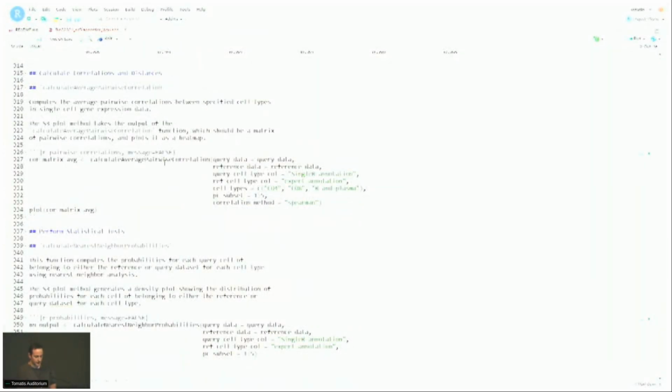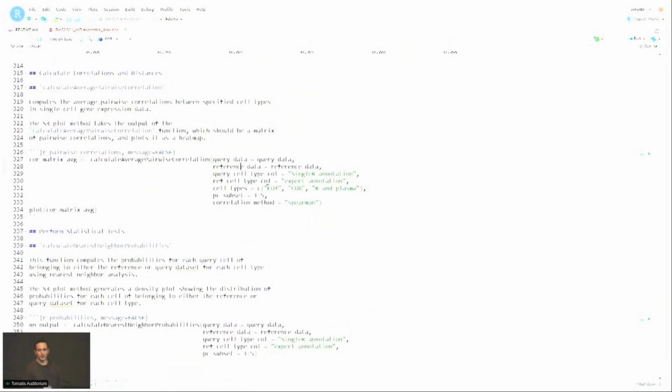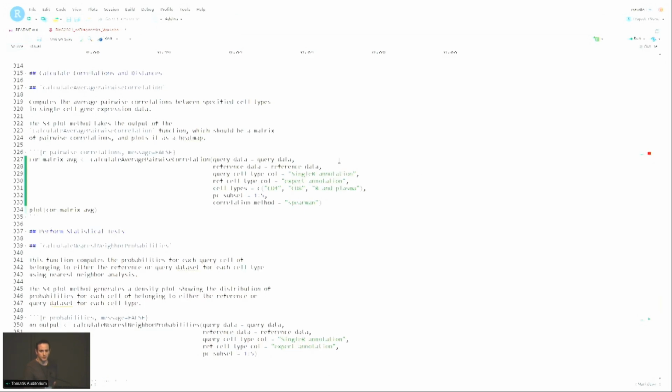Another very neat function here is called calculate average pairwise correlation. There's many different ways you can use this function. You can, for example, change the correlation method. If you look at the documentation, you can change which PCs are used to compute these correlations between the cells. And in essence, if you plot the output, you would get something that looks like this.